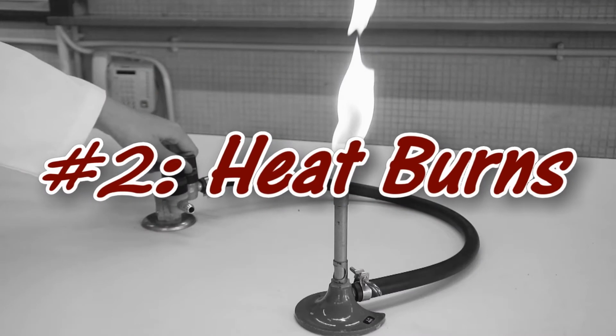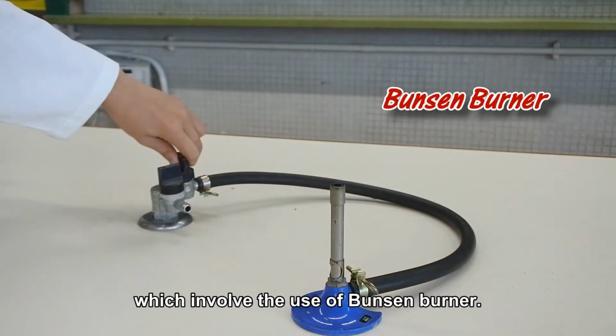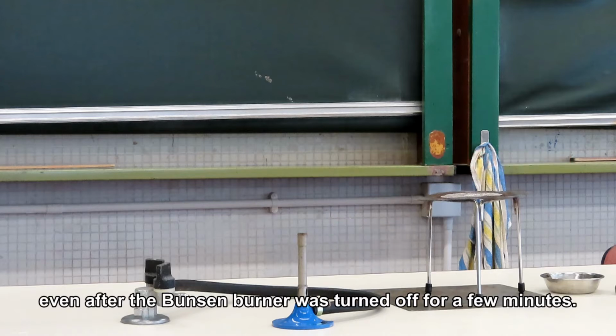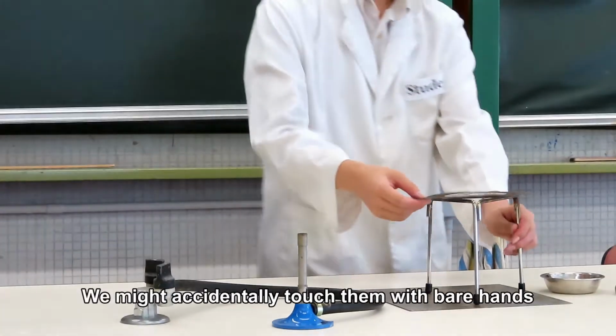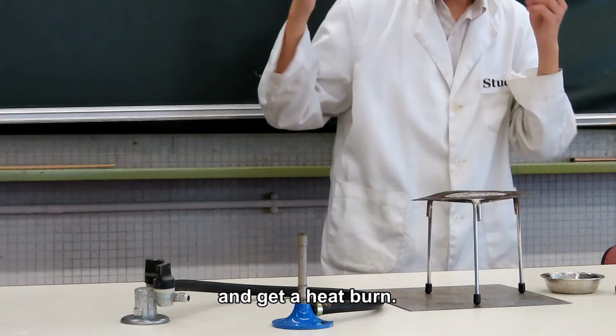Heat burns. Heat burns are common in experiments which involve the use of a Bunsen burner. For example, the wire gauze on a tripod remains hot even after the Bunsen burner was turned off for a few minutes. However, we may easily forget this after washing other apparatus. We might accidentally touch them with bare hands and get a heat burn.